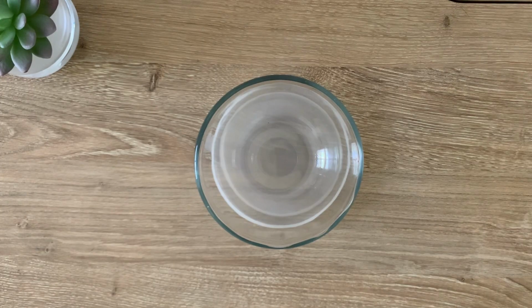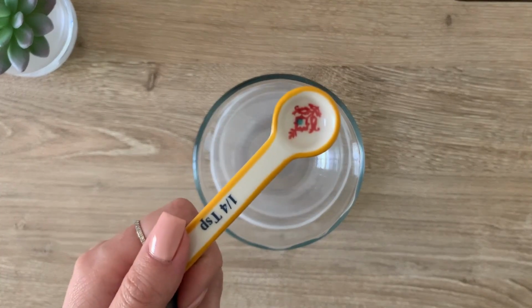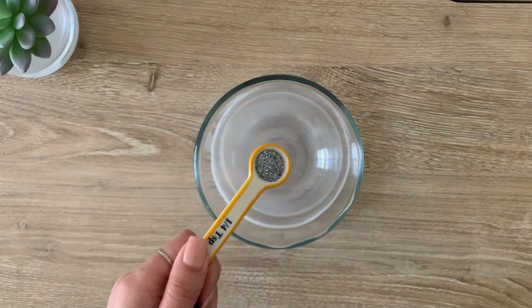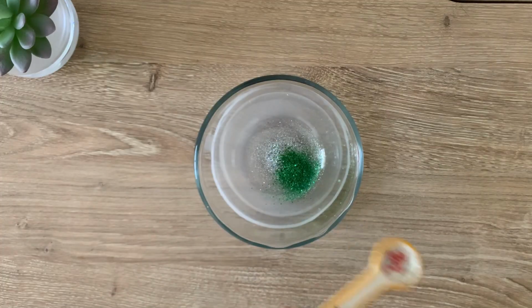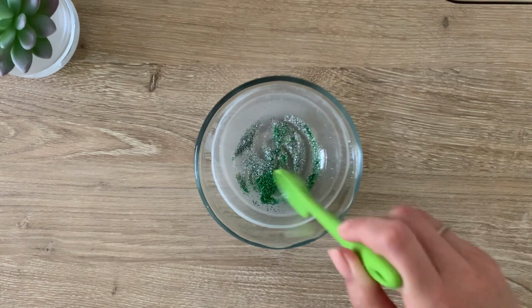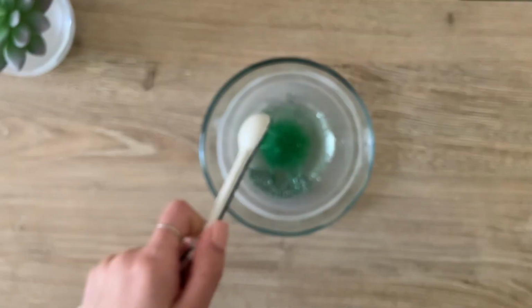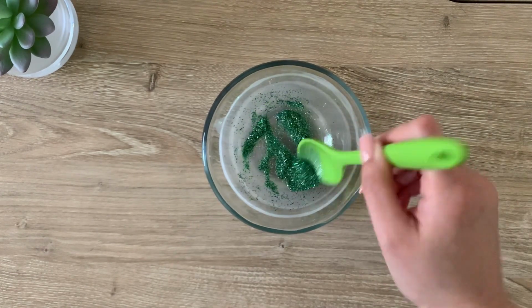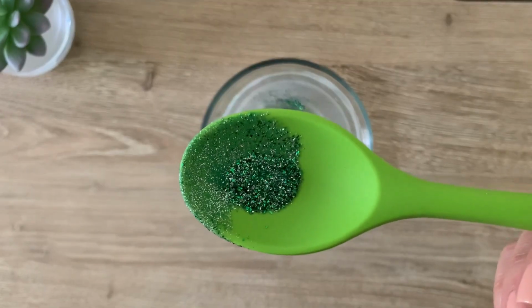In order to practice the technique of geometric dilution, you'll need 2 different colors of glitter. I'll be using a total of 1/4 teaspoon of silver glitter and 3/4 teaspoon of green glitter. But for now, I will add the smallest amount of glitter first, which is the 1/4 teaspoon of silver glitter. And then I will add an equal amount of green glitter and mix thoroughly. Once everything's mixed like this, I will then add the remaining amount of green glitter, which is 1/2 teaspoon of green glitter, and mix thoroughly. So geometric dilution ensures an even distribution of ingredients. So as you can see, the green and silver glitter are evenly mixed.